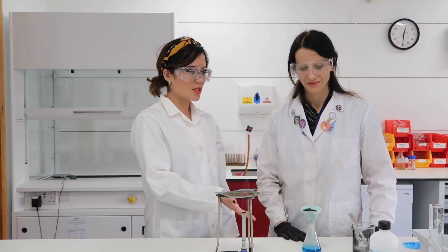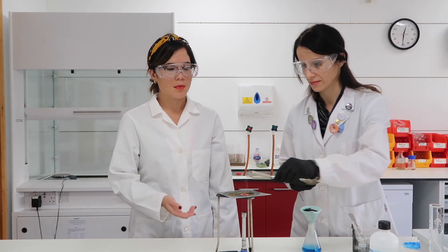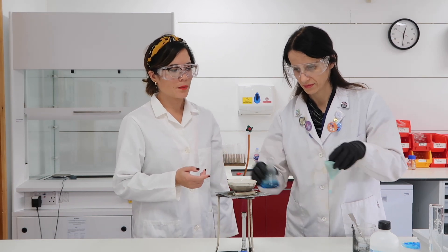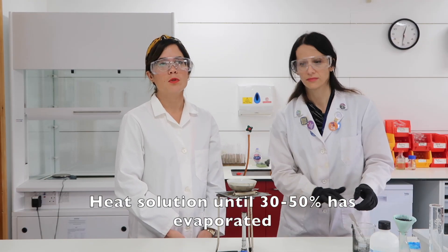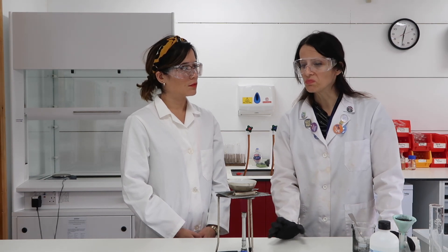We've got enough of our copper sulfate solution now. We're ready to do the evaporation part of the experiment. Emilia is using a clay triangle to support an evaporating basin, and now she's pouring the copper sulfate solution into the basin. Notice here you must evaporate only some of the water — not all of the water, just some. Emilia tells me that actually affects the size of the crystals. Yes — if you evaporate a lot of water, the crystals will be very very small. So you want to evaporate about one third of the water.